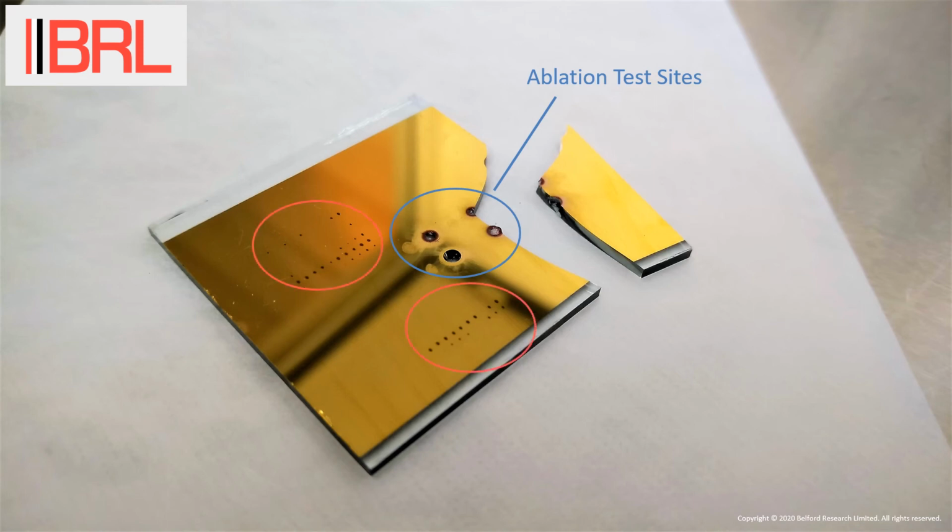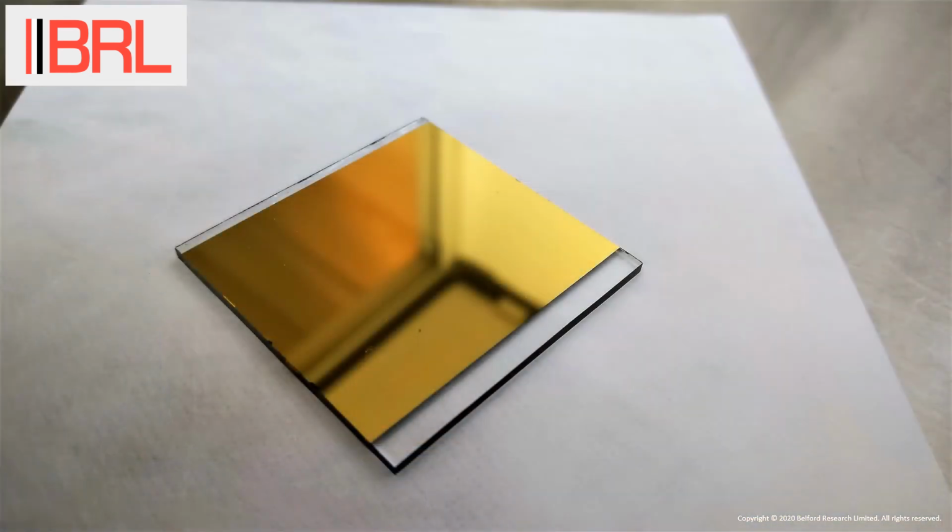Arrays of normal damage test sites are shown on this sample. The ablation power used here was at least 50% above the total failure point and was enough to fracture the substrate. Here is a video of that ablation. And this was it before testing.